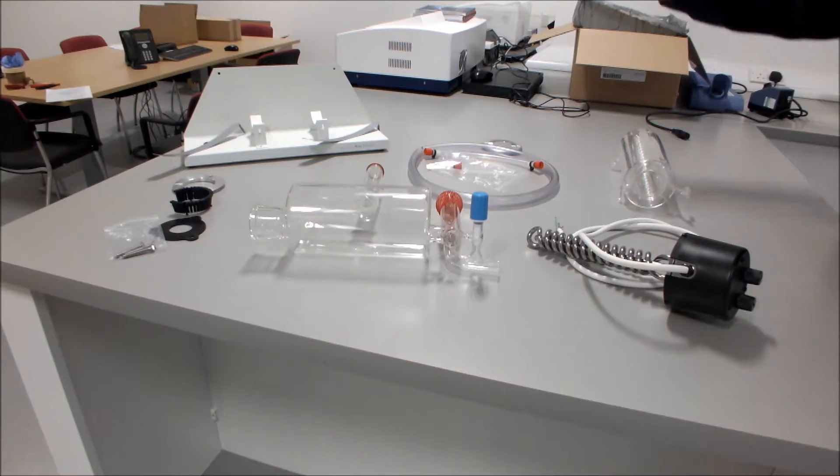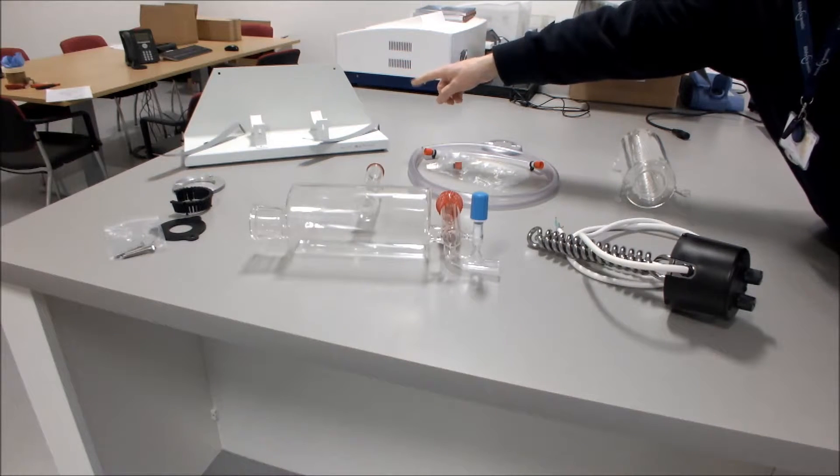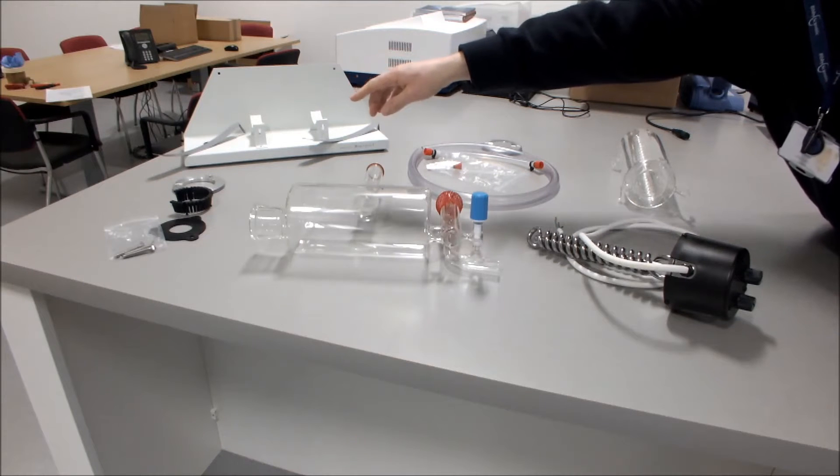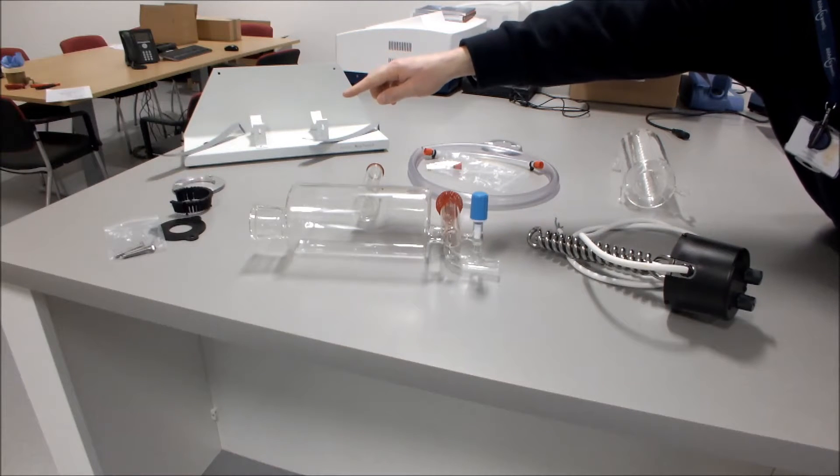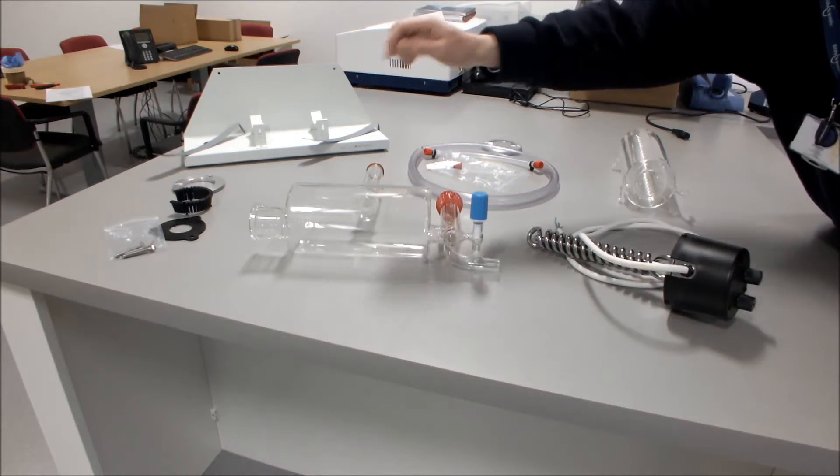You should have a boiler stand with two straps. You should have the gasket kit which consists of the flange, plastic insert, rubber gasket, and three screws.